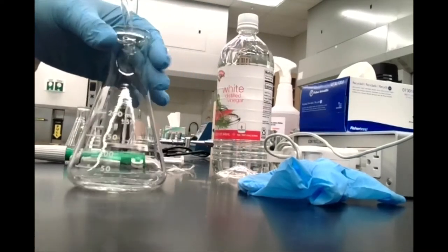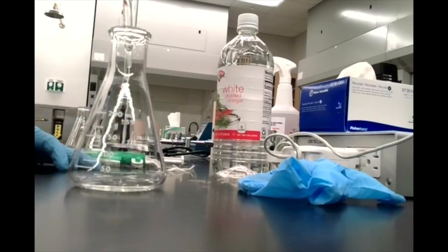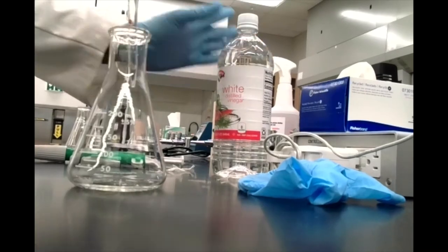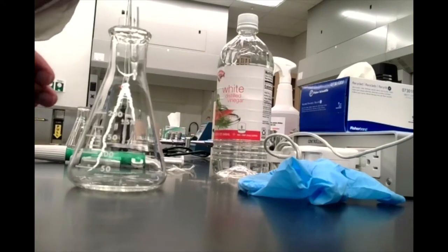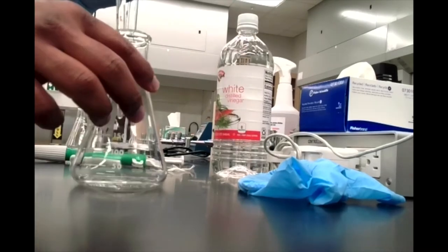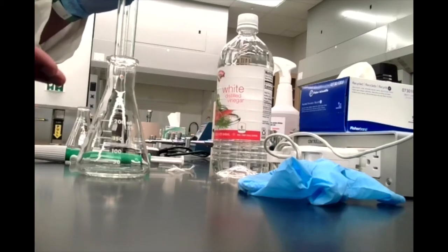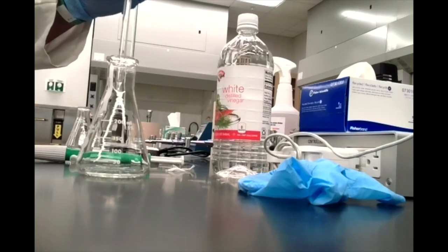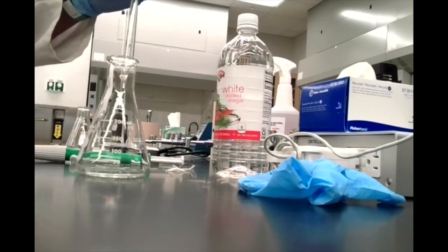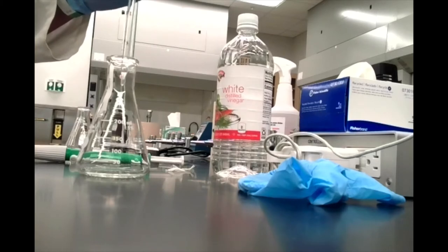Adding water will dilute the concentration, but since you're basing your calculations off the vinegar you measured, that extra water doesn't actually affect your calculations. I personally like using the smaller volume — since the concentration is a little bit higher, it's sometimes easier to see the color change. So I'm going to leave it the way it is.